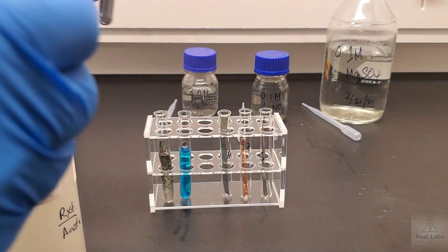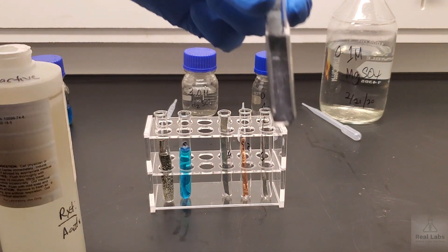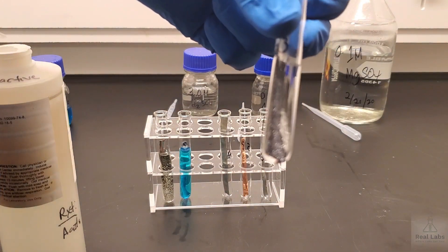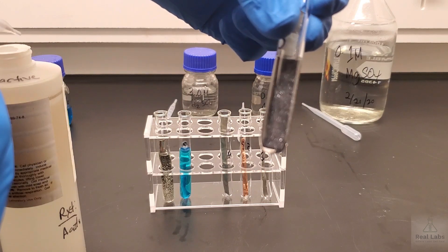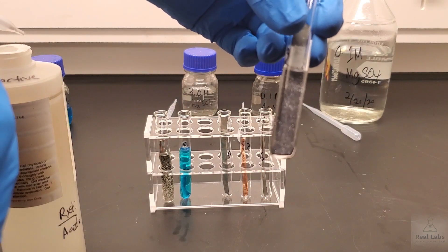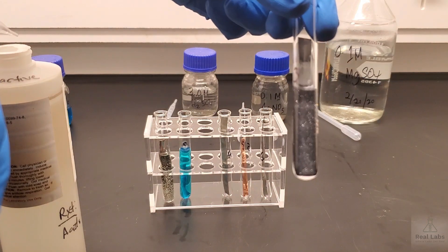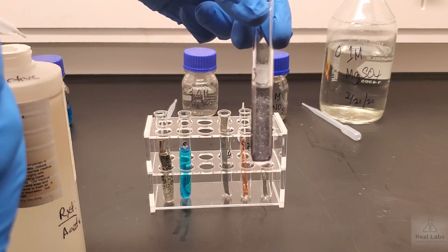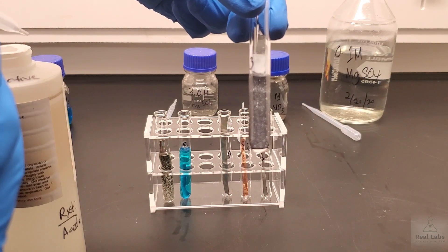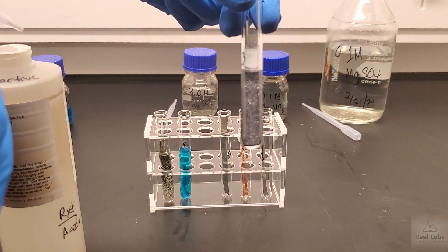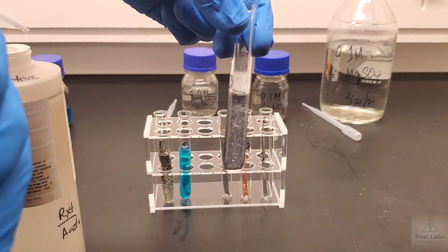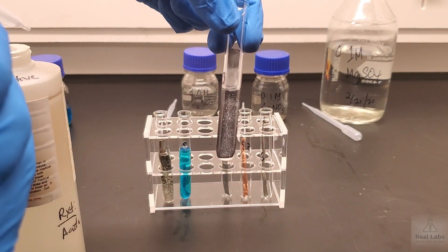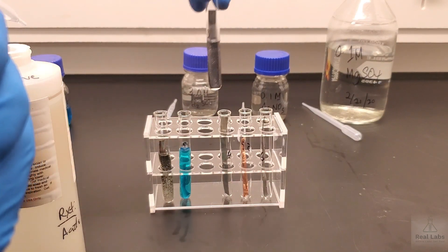We'll add just a little bit more to that. Then we'll take a look. If you just take a look at that, it seems to be some little bubbles on the surface there. We'll see if that changes color. If you look at that carefully, look below the liquid level. See how it looks very much darker, and above how it looks a lot lighter. That should tell you that there's probably something going on in this vessel. But we'll come back in about 10 minutes to take a look at this.